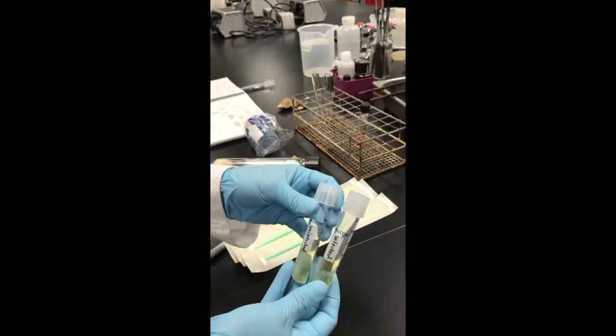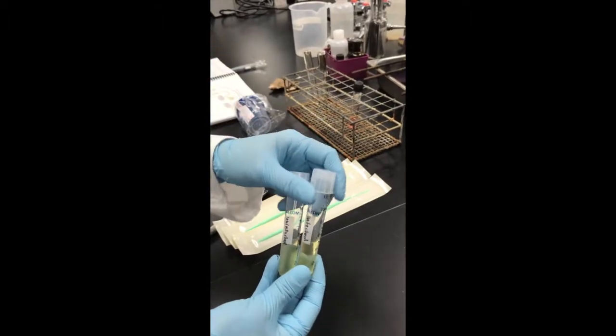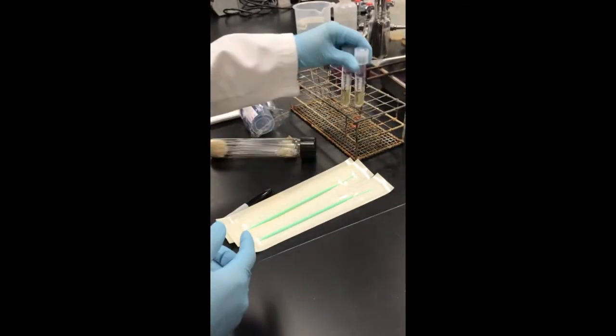After you have added your one drop of serratia into your infected control, you're going to incubate these until the next lab period.